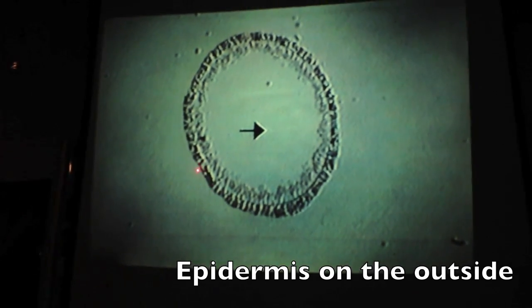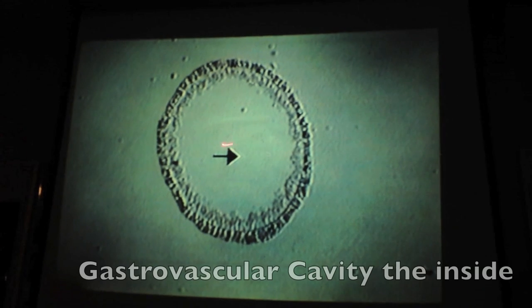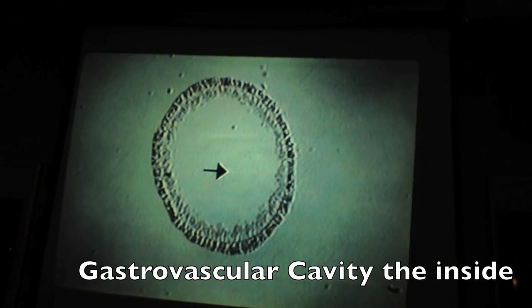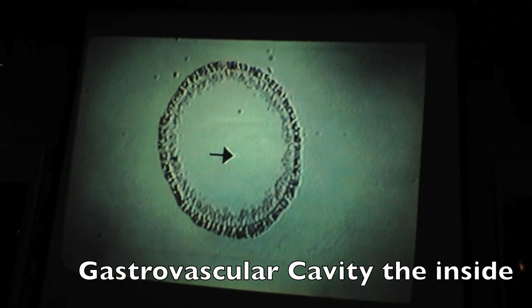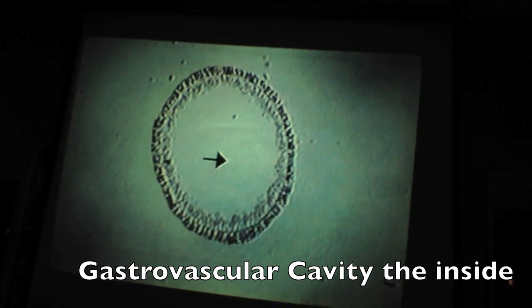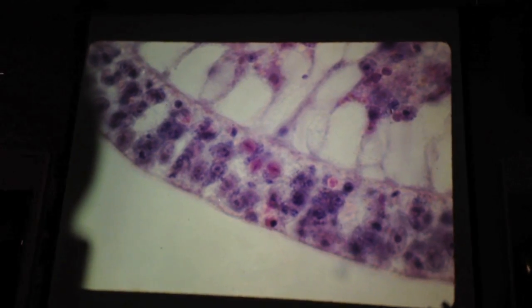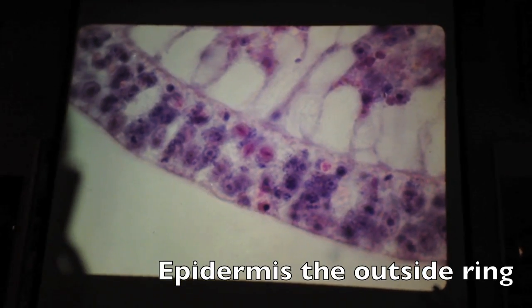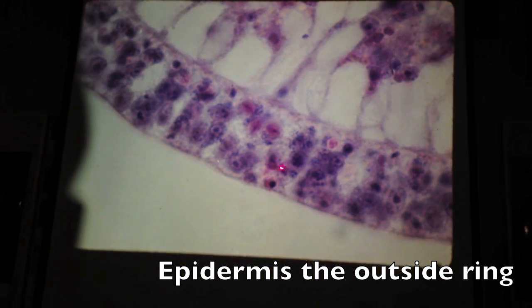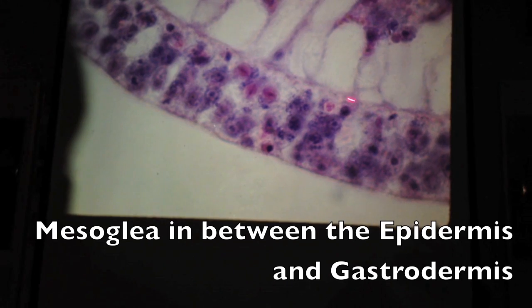Okay, this is a cross section through a hydranth. Epidermis, gastrodermis, in between it is mesoglea, and then gastrovascular cavity. Gastrovascular cavity, they call it a coelenteron. So you can use either one. Gastrovascular cavity is easier to spell. This is just showing it up close and personal, so you can see the three layers, two tissue layers and the gelatinous layer. So epidermis, gastrodermis, and then mesoglea in between.